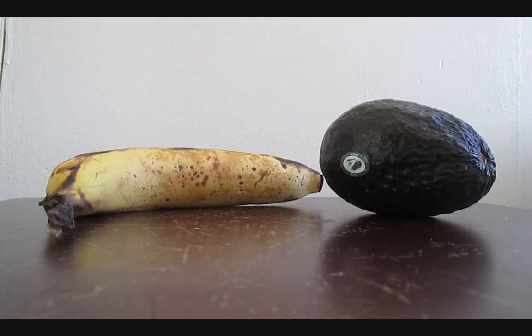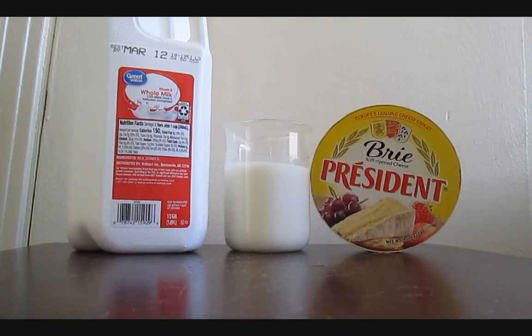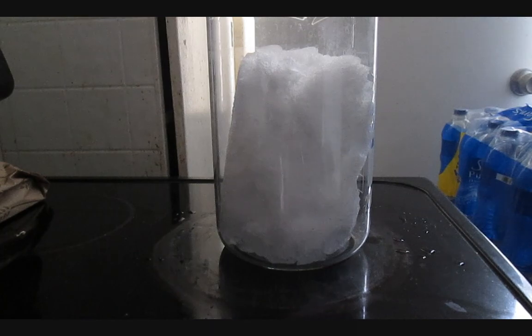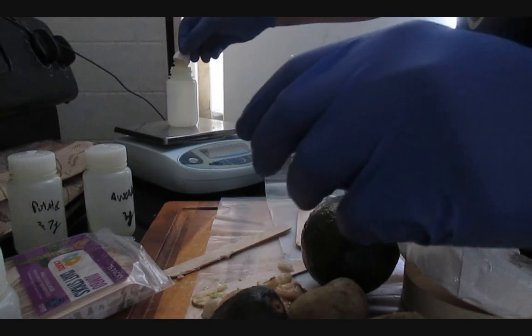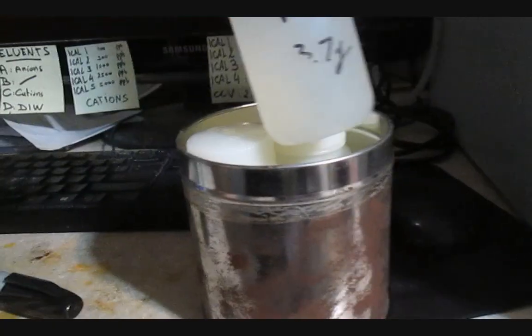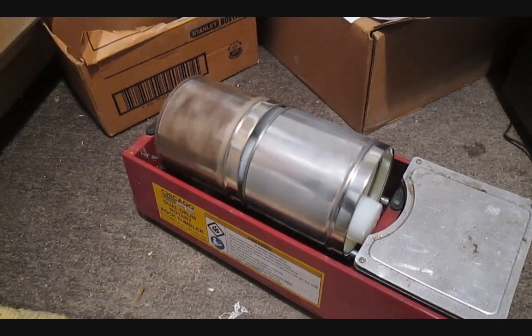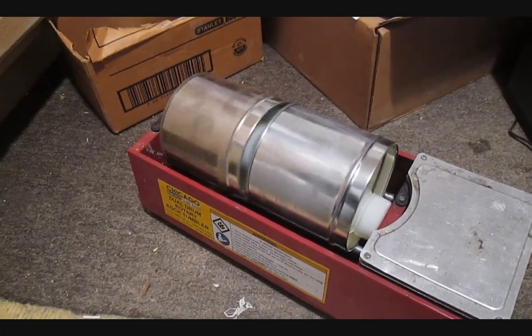Beyond this silliness, I've also analyzed avocado and banana for potassium, cheese and milk for calcium, some fish, potatoes, snow, and my own urine — because why not? Solids are weighed first and digested in a fixed volume of deionized water. Digestion happens during overnight tumbling when soluble ions are extracted by the water. The extract is then filtered and analyzed.